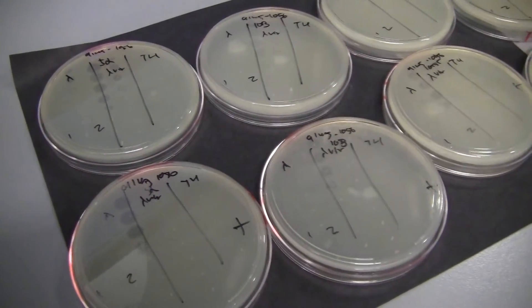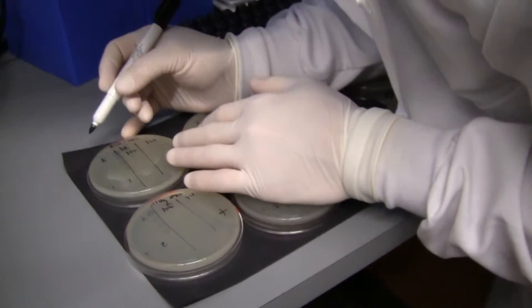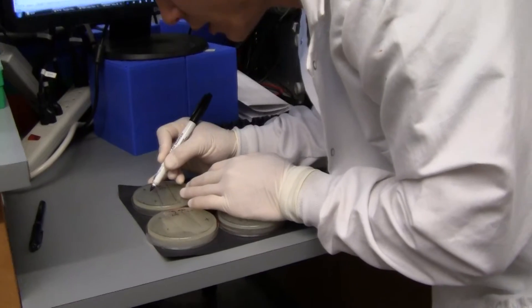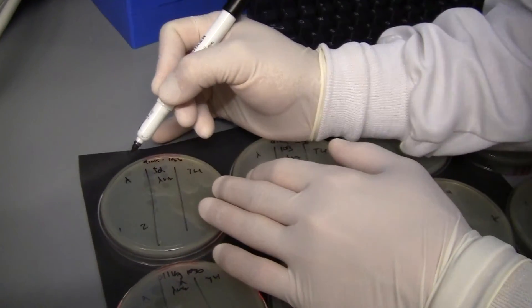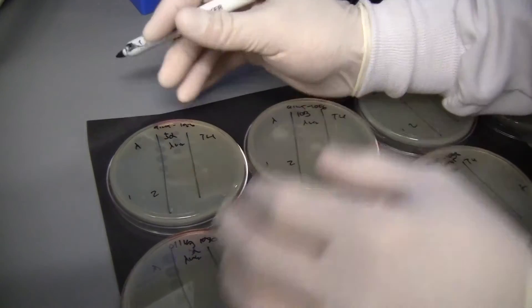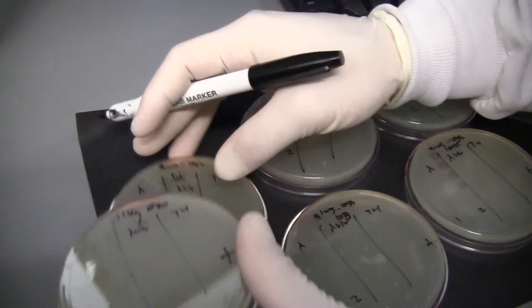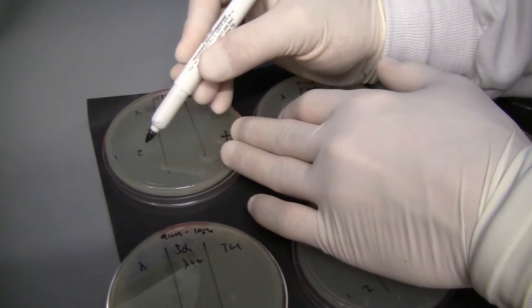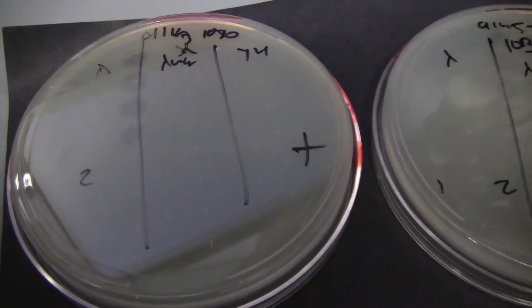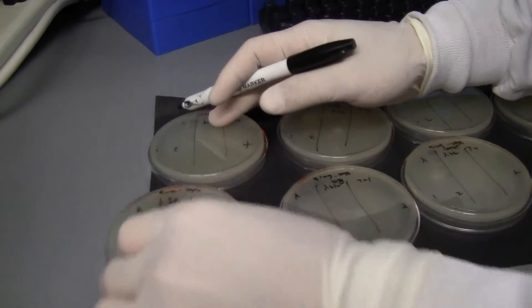Now we're going to run the numbers and go from plates to a graph. I'll stand up here and count how many spots I can go down before I don't see any phage plaques. One more thing: yesterday I mentioned I like to stab my agar plates, and now you can see why. Where there are clearings it's really obvious where the spots went, but on plates where I have protection, the only indication I have are those little white dots I put there — so they really help knowing where to look for a phenotype.